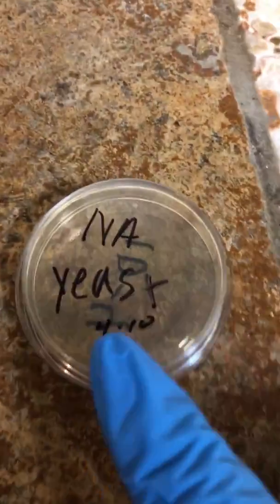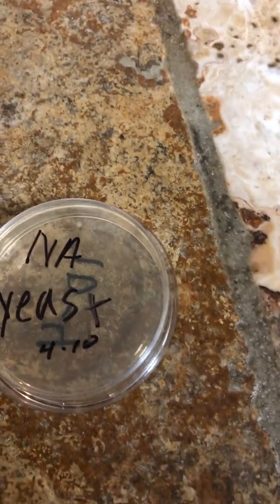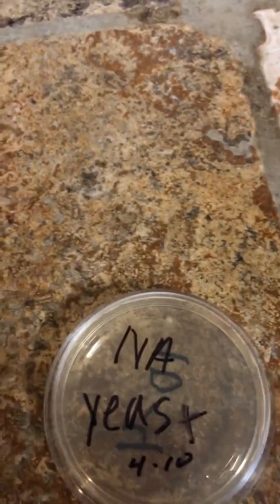So basically, once I got my viable specimen, I would calculate that and get my number so I can get the final number of what I thought was in the total specimen.